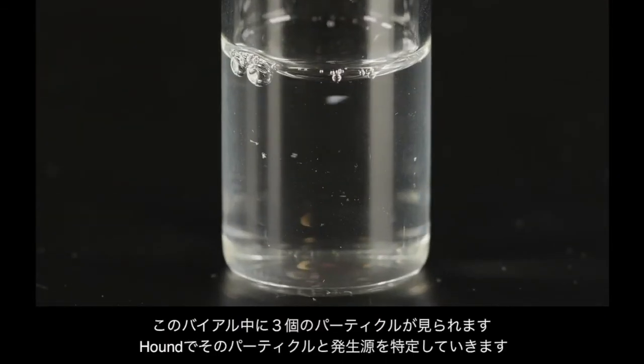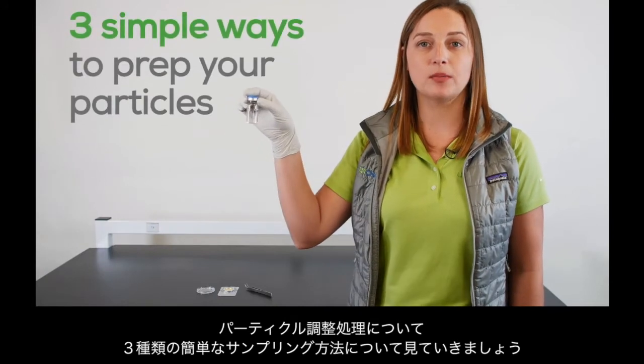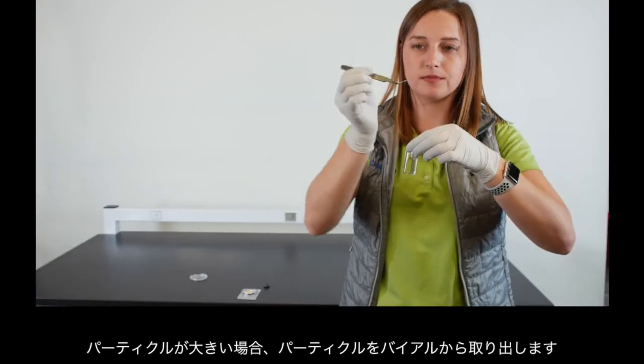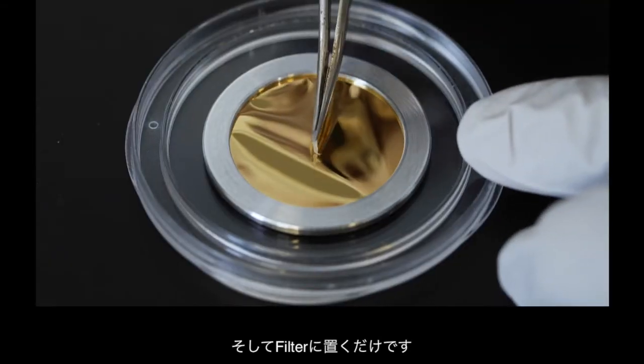In this vial, we see 3 particles. Let's use Hound to identify the particles and their sources. Let's get started with 3 simple ways to prep your particles. If the particle is large enough, you can just pluck it out of the vial and place it on the filter round.